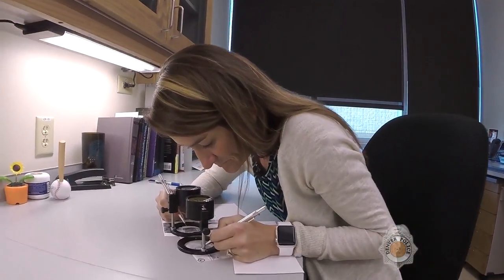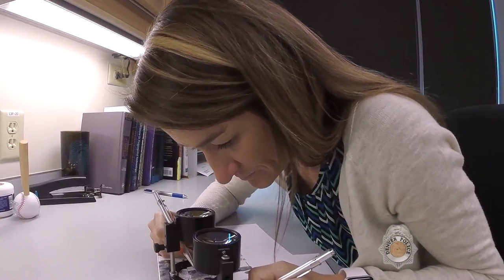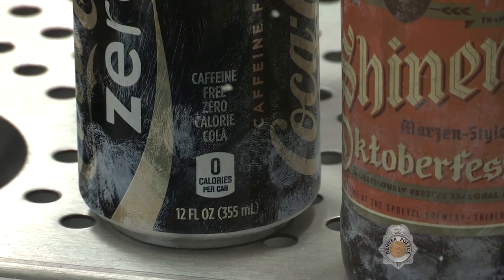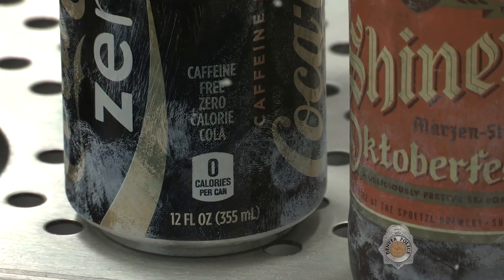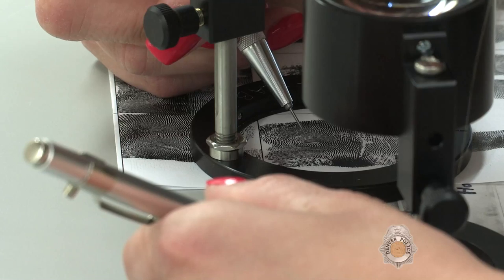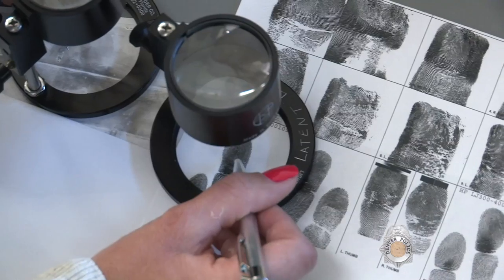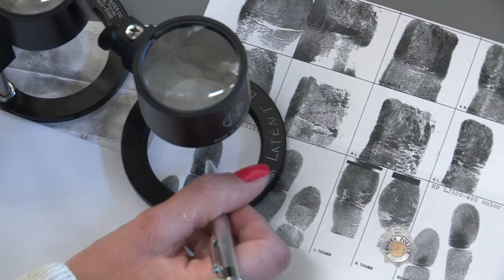The main responsibility of the latent prints unit is to process evidence for the presence of latent prints, then compare them to known fingerprints and palm prints.